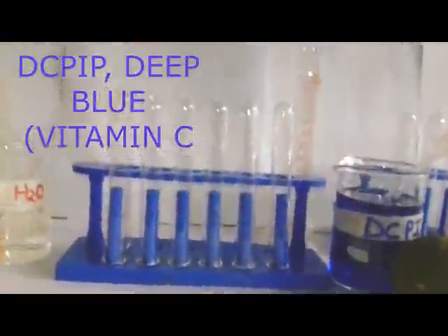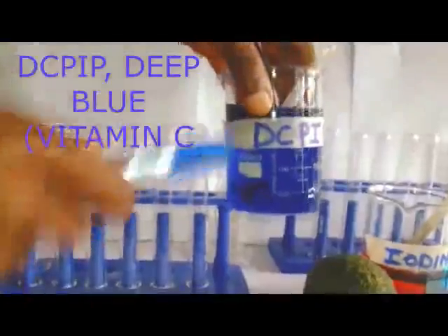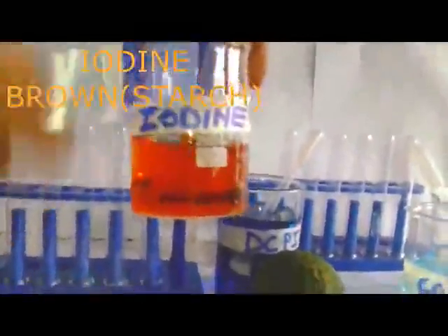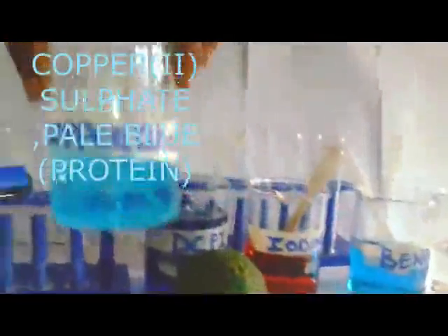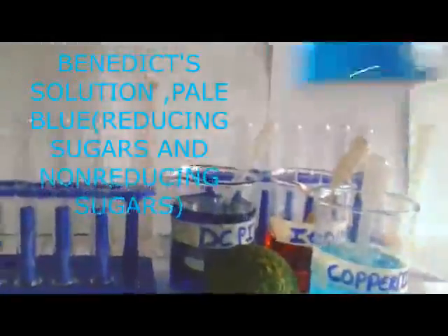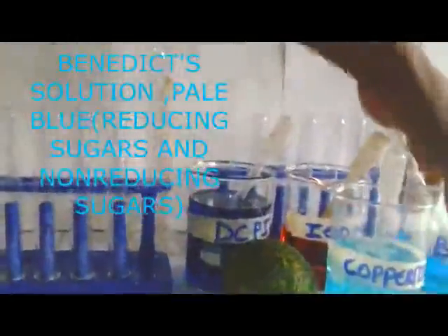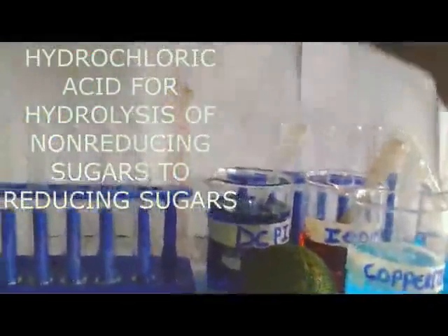Grasp the reagents and their colors properly. You have to master the reagents and their colors. Finally: DCP-IP, deep blue, vitamin C. Iodine, brown or even yellow, starch. Copper-2 sulfate, pale blue, proteins, but remember, in combination with sodium hydroxide. Benedict, sugars, specifically reducing and non-reducing sugars. HCl, we shall see it in non-reducing sugars. Take note of those colors.